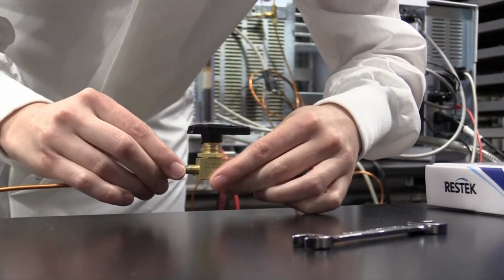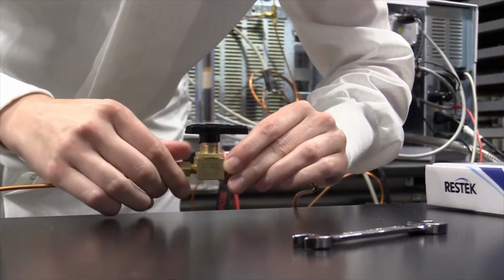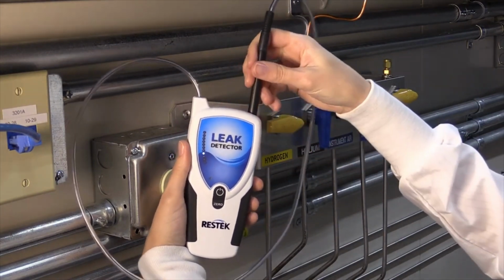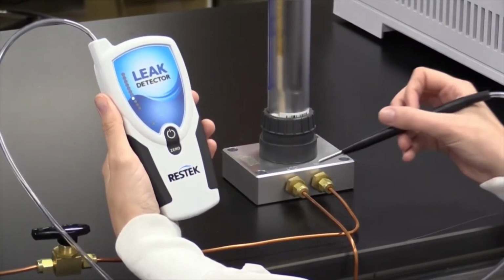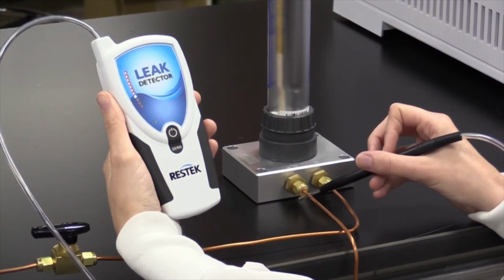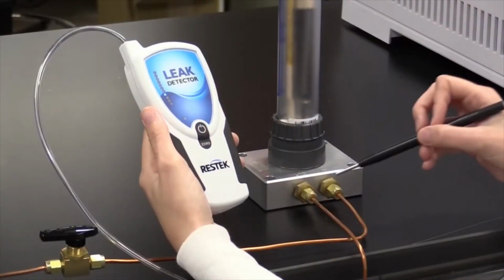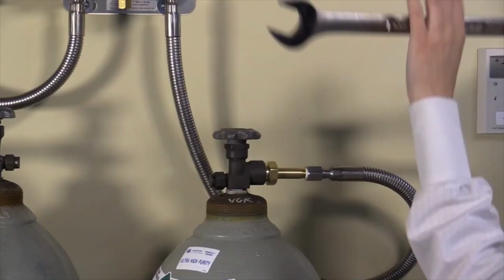As moving parts and valves age and wear, they can become another common location for leaks. Replacement may be necessary. After installing new gas lines, always remember to pressurize the system and check for leaks. Check for leaks anytime you install new or replacement gas filters. If one of your gas filter compression fittings is leaking, check the fitting to make sure it's in good condition. Then, tighten it appropriately. Afterwards, continue to routinely check around seals and fittings.